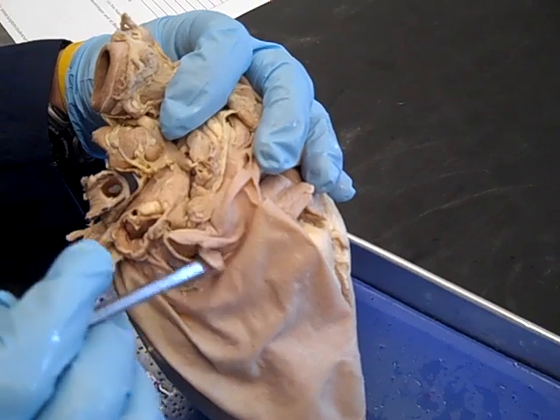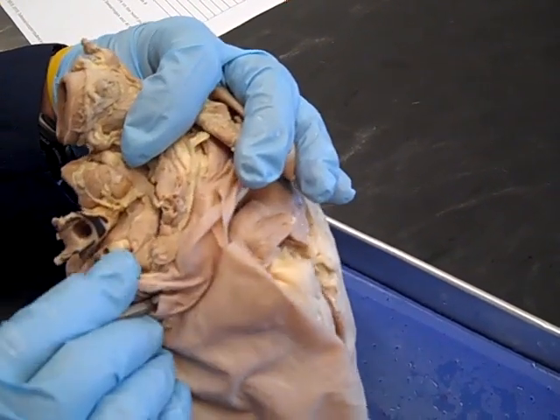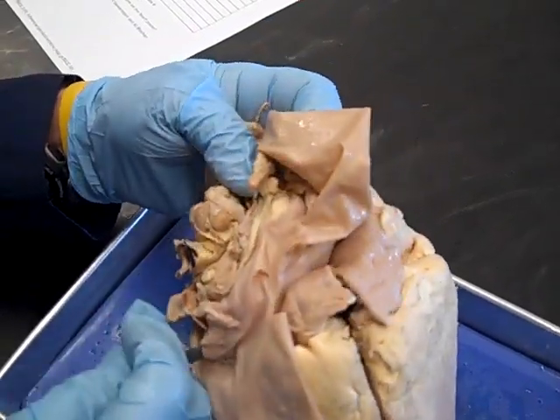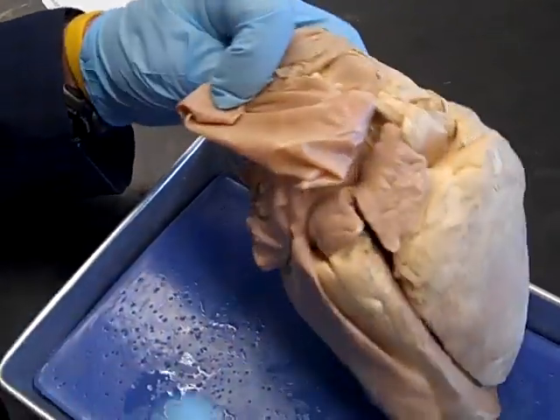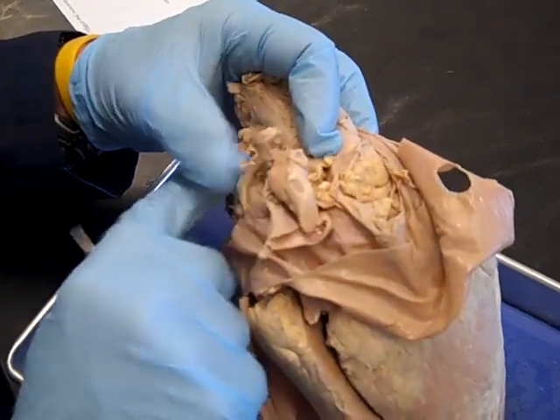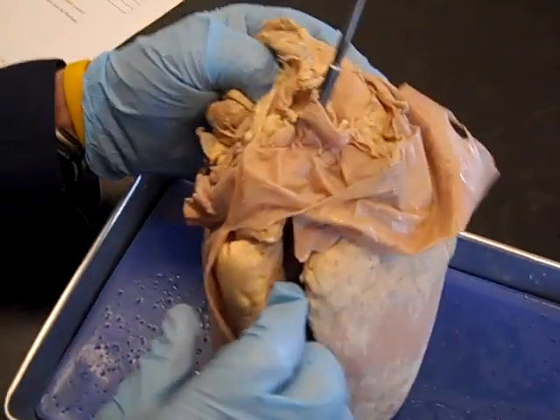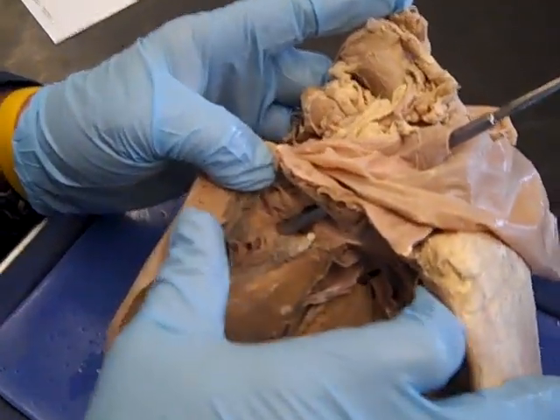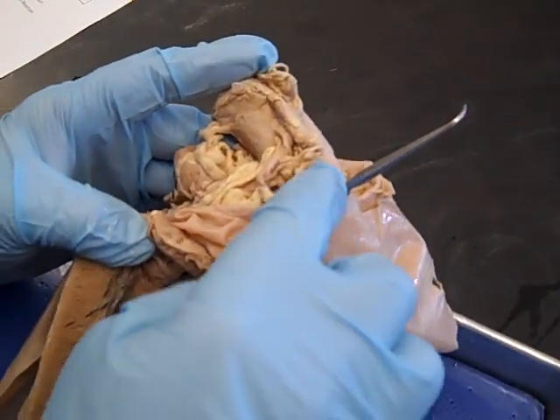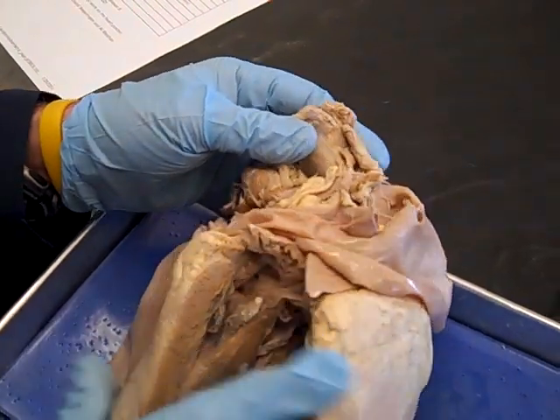Here's another opening — we can tell it's a vein because of its thin walls. This one goes into the right atrium, so this must be the caudal vena cava. And over here, another thin-walled opening that also goes into the right atrium — this is the cranial vena cava. You can see the right atrium and right ventricle, and there's the probe coming out into the right atrium from the vena cava.